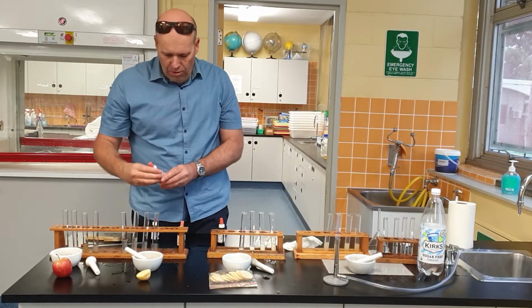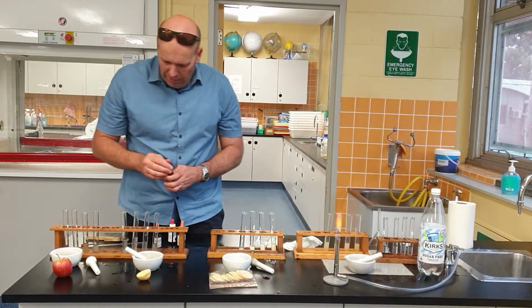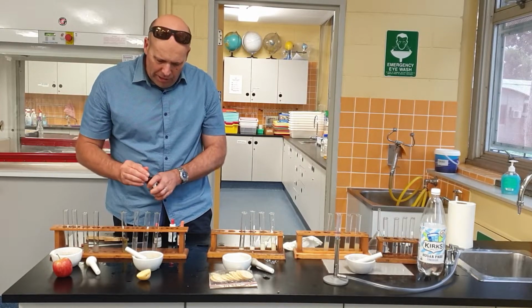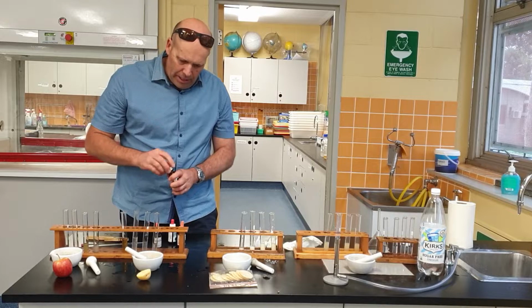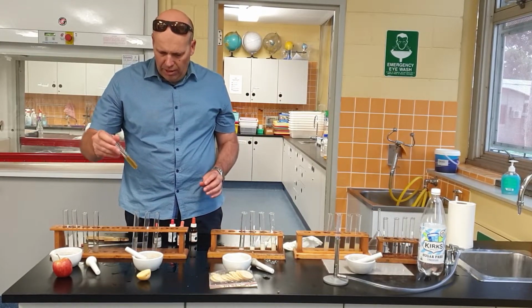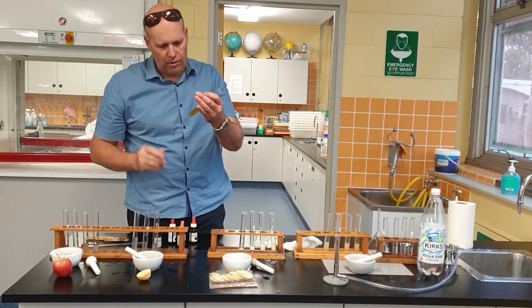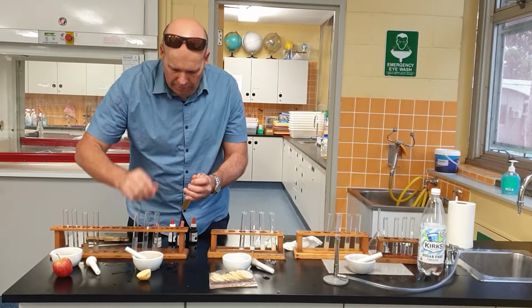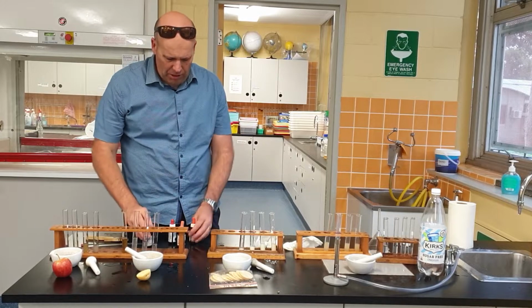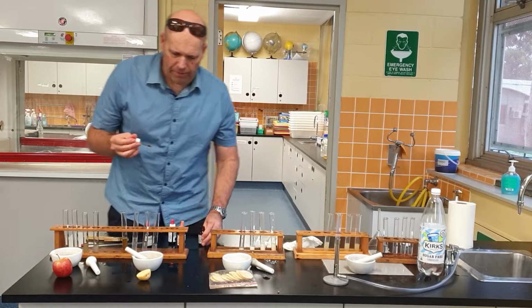Welcome back. So here we go again. What do we got? Well, let's try it. So first one, we're going to test for starch. I'm going to put my iodine into my potato solution, and what would you say? You would think that absolutely it's gone, but it hasn't gone super black. You can see it's gone a little bit darker, but let me just try this, people, and I'll bring it up a bit closer to you so you can see.